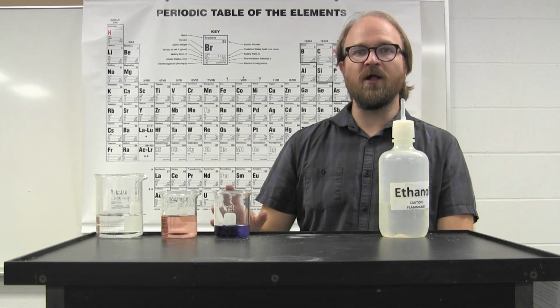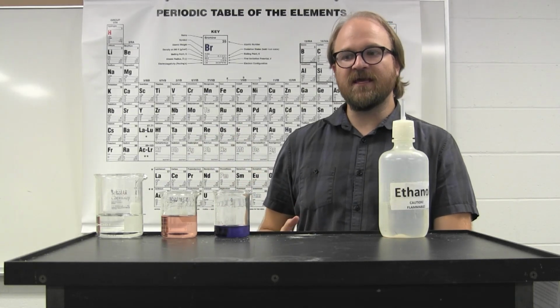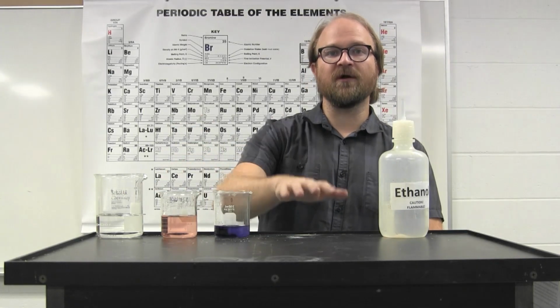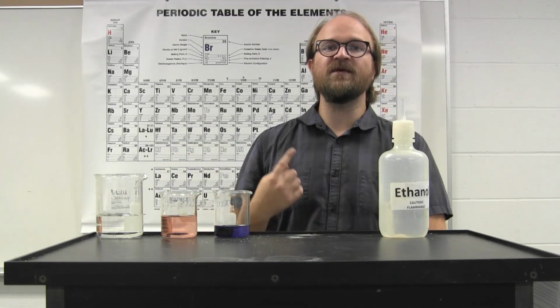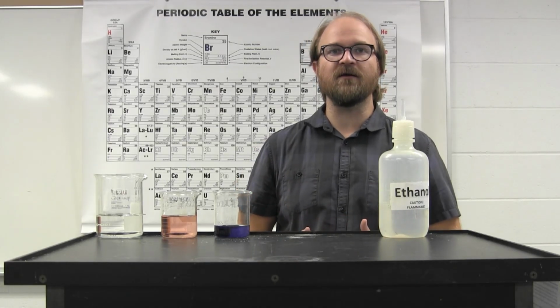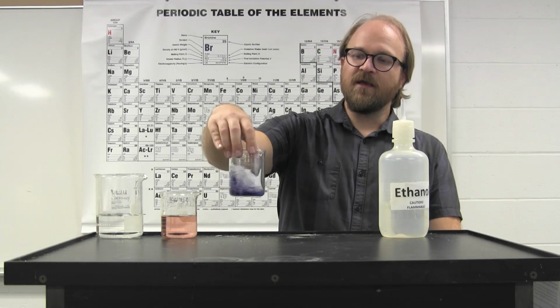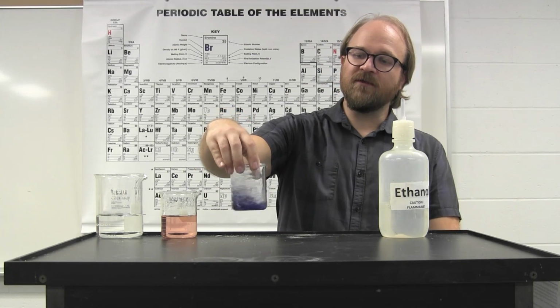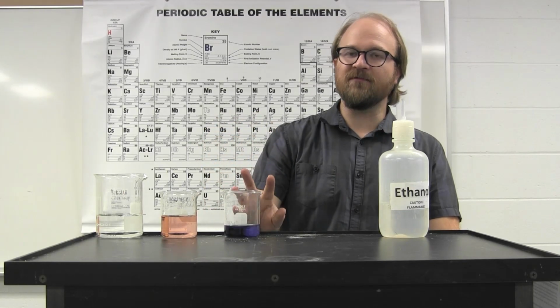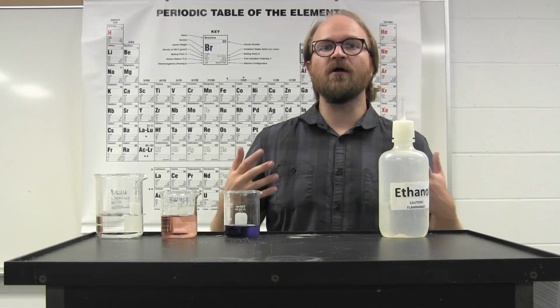If you were to take an absorbance spectrum of either of the pure compounds, you would only see one peak, one primary wavelength of color that absorbs the most. However, using the blend of cobalt tetrachloride and cobalt hexaquo, there are 2 peaks.